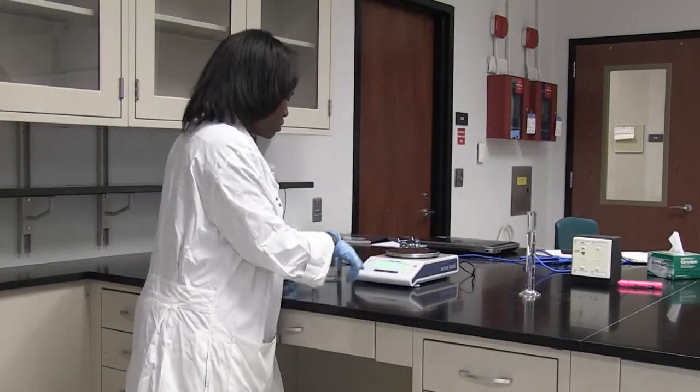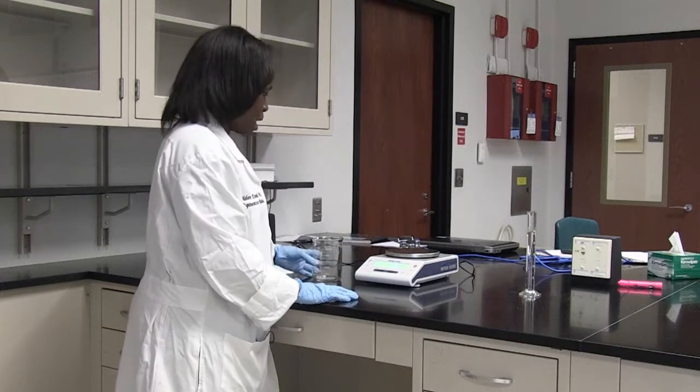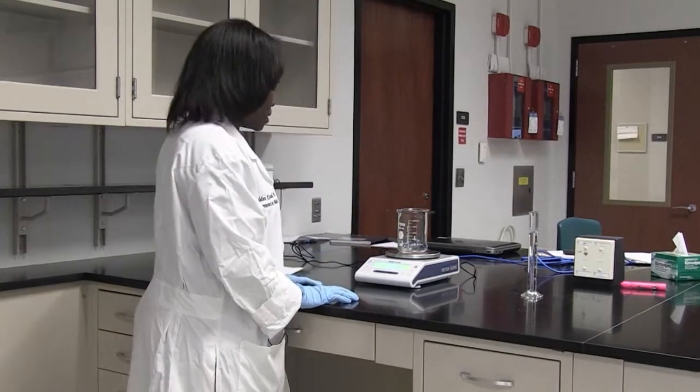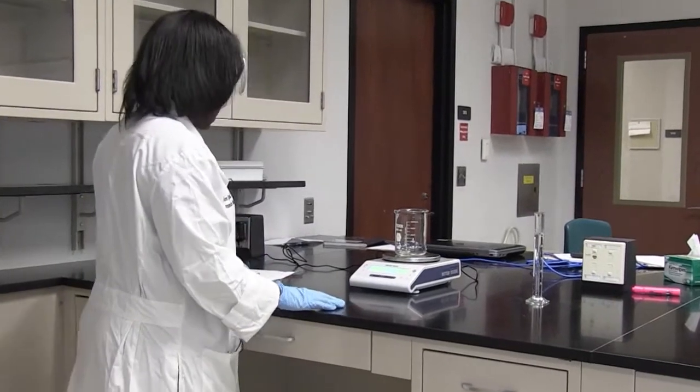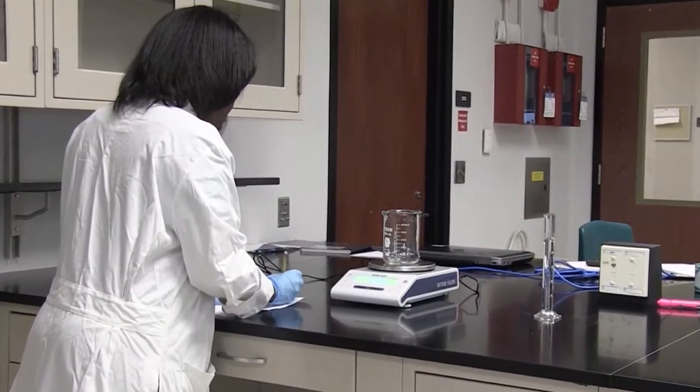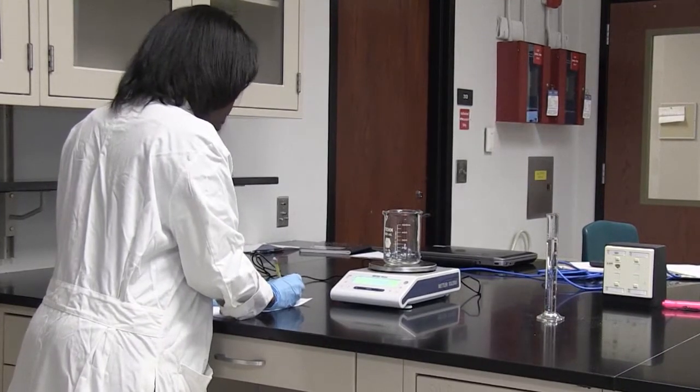So I make sure that I zero my balance. I place my beaker on and I record the weight. And it's telling me that the weight is 173.9 grams.